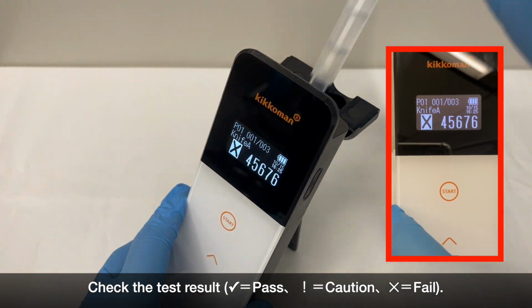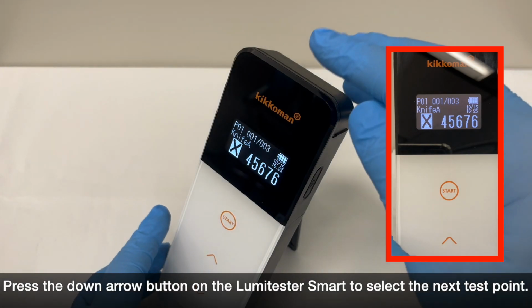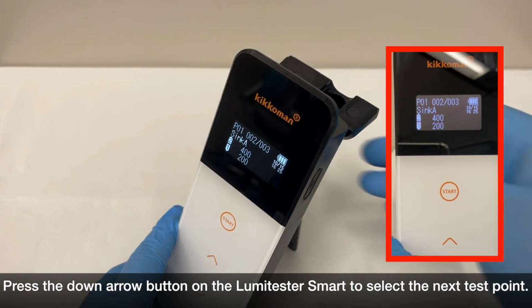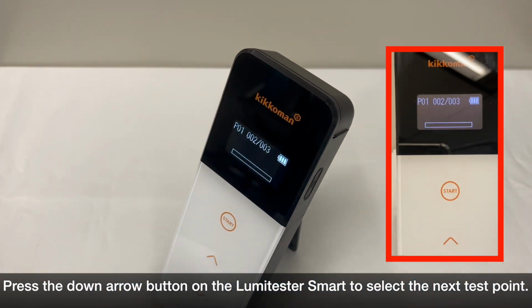A check mark means pass, in other words, clean. An exclamation mark means caution is required, and a cross mark means fail, which means dirty. For now, here is a cross mark which means fail. When one test is complete, select the next test point by pressing the down arrow button.